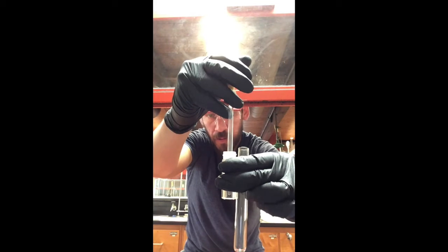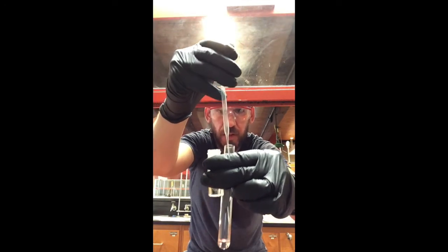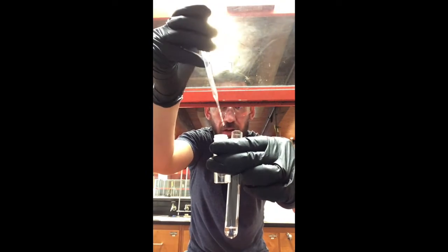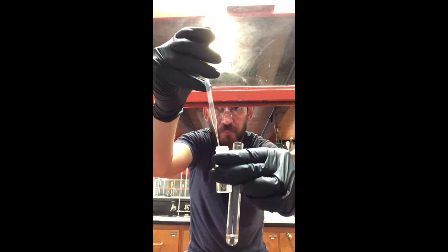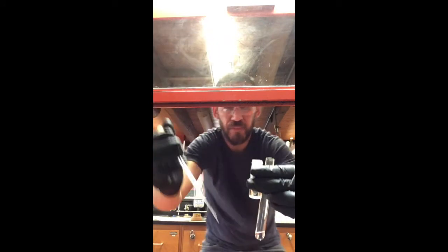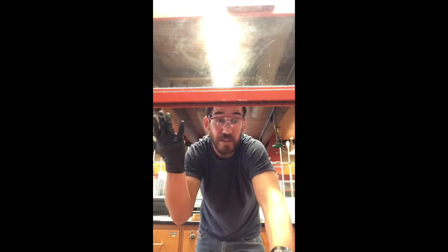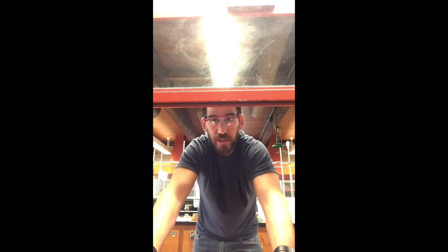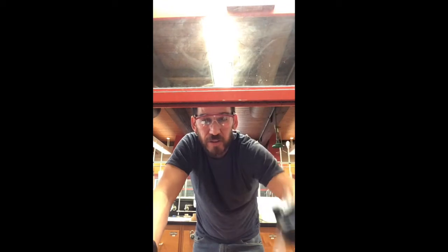That was pretty much all of it — there's a tiny tiny bit left in the bottom. Getting every last drop takes practice, as it requires dexterity working with one hand while manipulating the pipette bulb. You just try, see what happens, and adjust. Now that we've got our methylene chloride in the test tube and don't see two layers, we're going to add sodium sulfate.